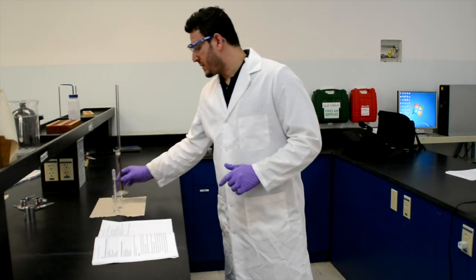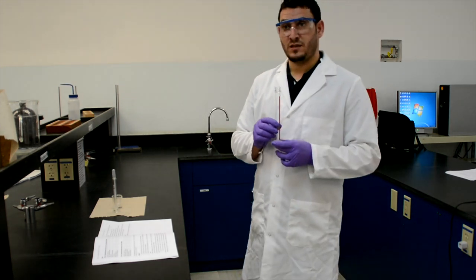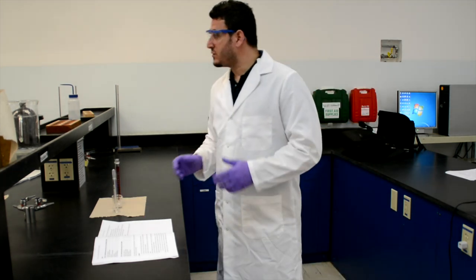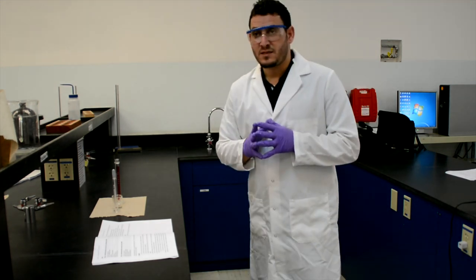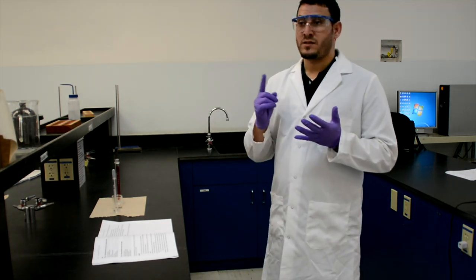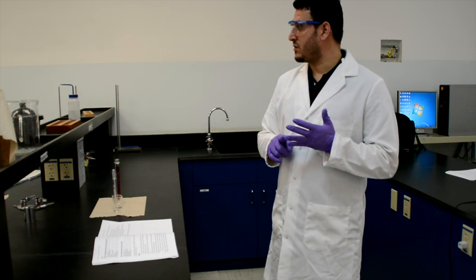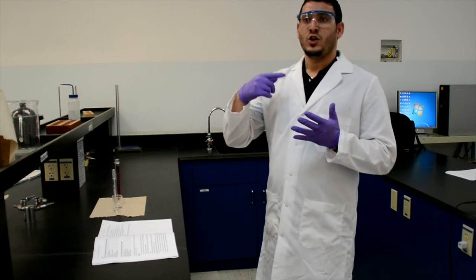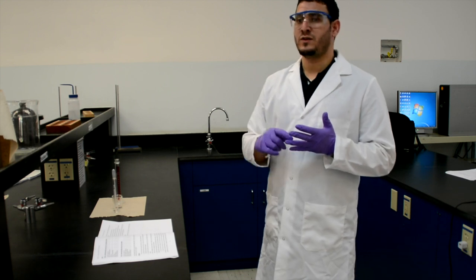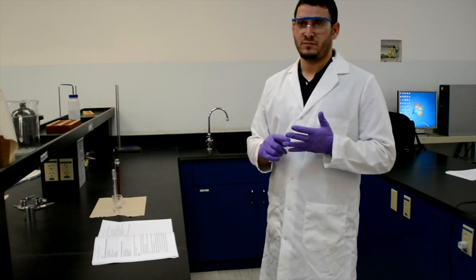That's why before you fill your beaker with water, you have to measure its mass empty. The same thing applies to the graduated cylinder. So what you need to do today is measure the mass of the empty beaker and the mass of the empty cylinder, and then measure the mass of the water you fill in.